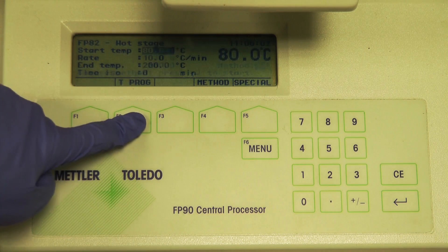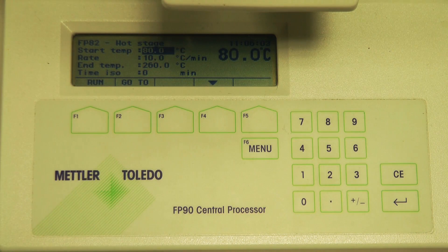Use the controller under the microscope to set the temperature program and set appropriate start and end temperatures.